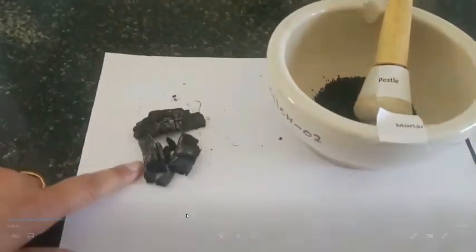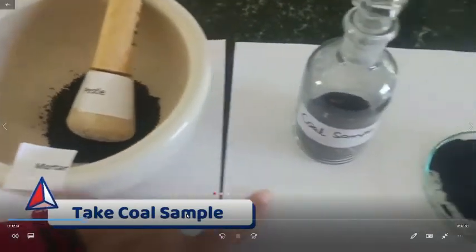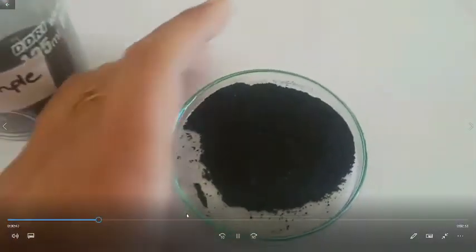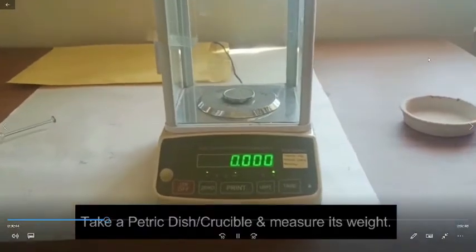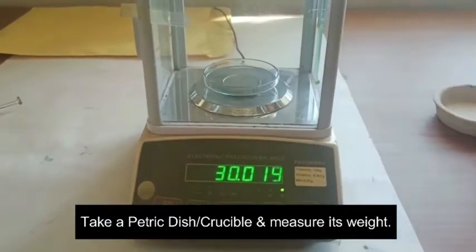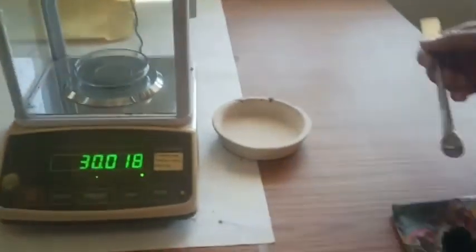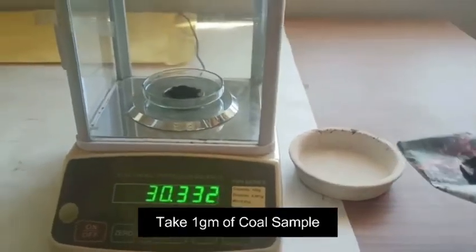Here is the coal. It is crushed in the mortar and pestle, then it is sieved, and I place this in the reagent bottle — here is the coal sample. Now we are weighing the petri dish, and this weight is recorded in the table.